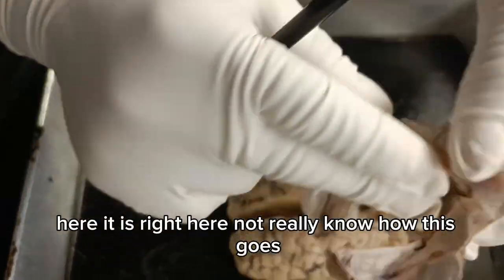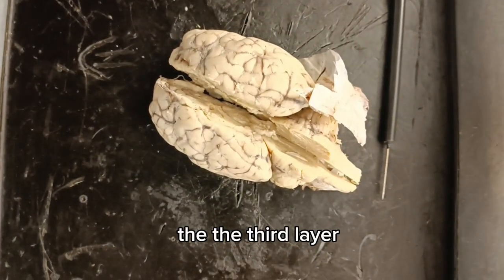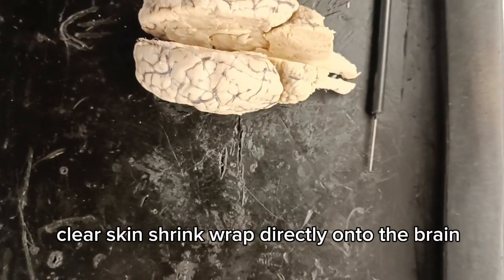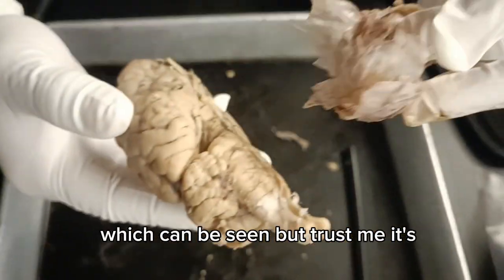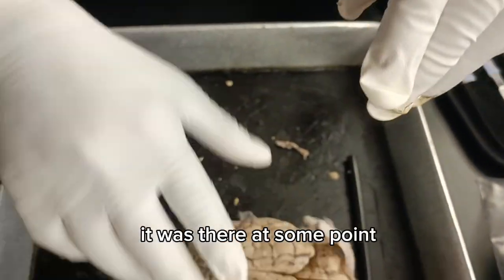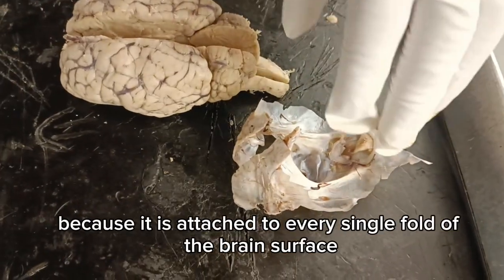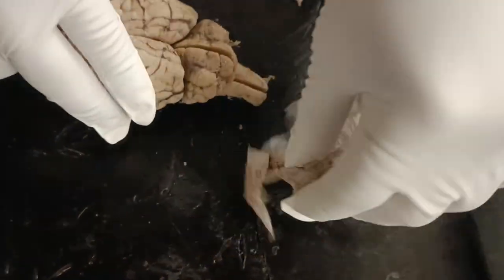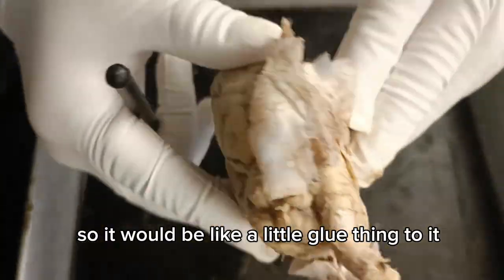Here it is right here. The third layer, which is the pia mater, is missing because it is a microscopic clear skin shrink-wrapped directly onto the brain, which can't be seen, but trust me, it was there at some point. You can't peel the pia mater off because it is attached to every single fold of the brain surface, so it would be like a little glue thing to it.